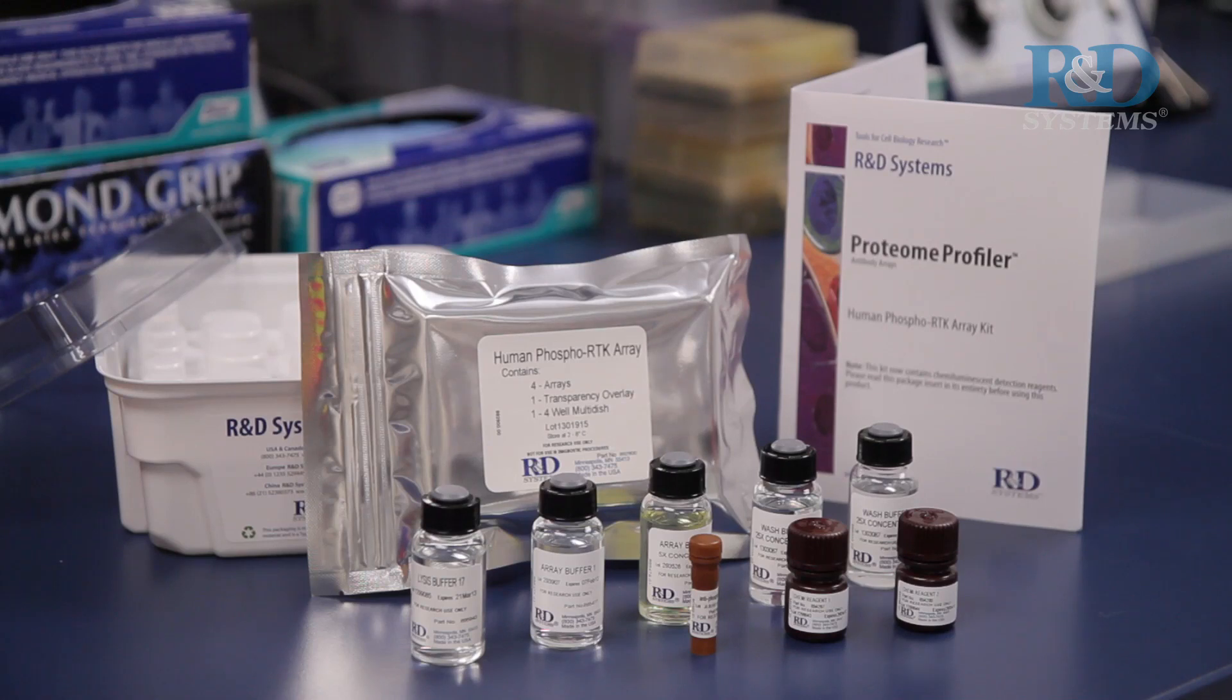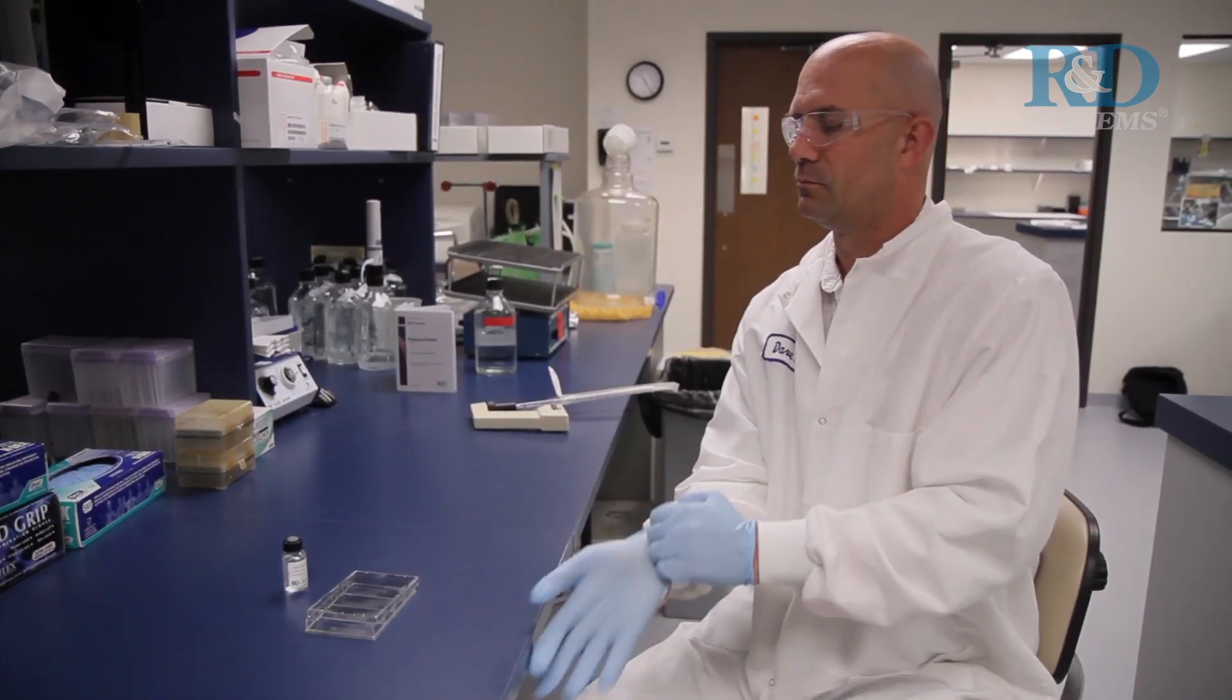Prepare for the array assay by bringing all kit components to room temperature before use. To avoid contamination, wear gloves while performing the procedures.